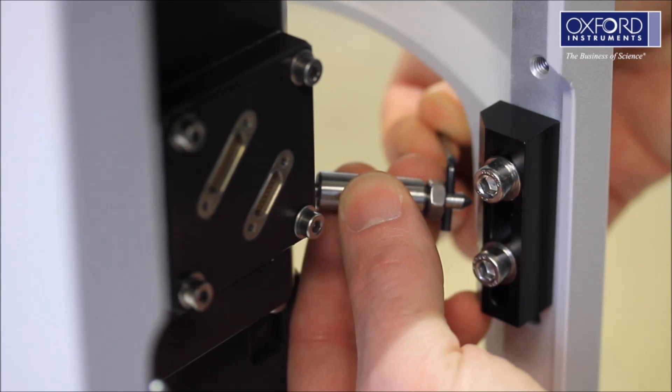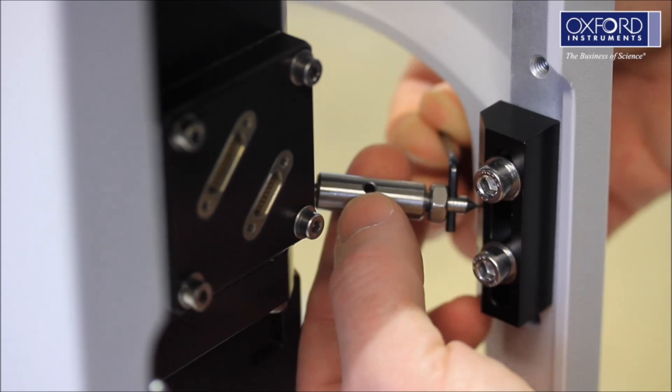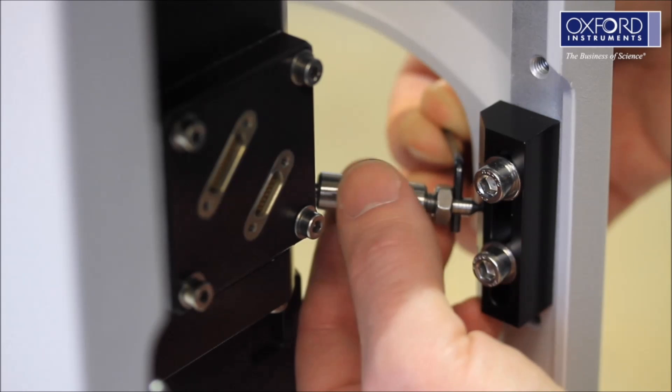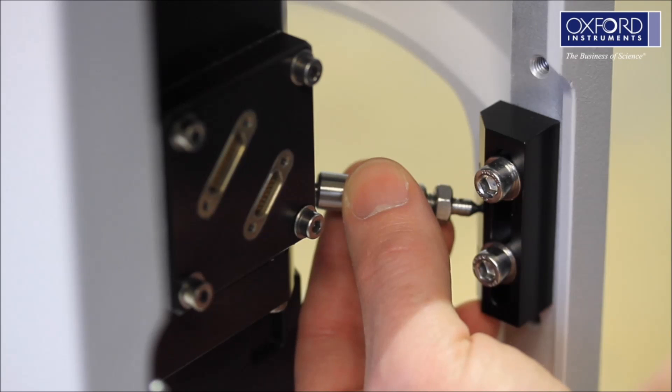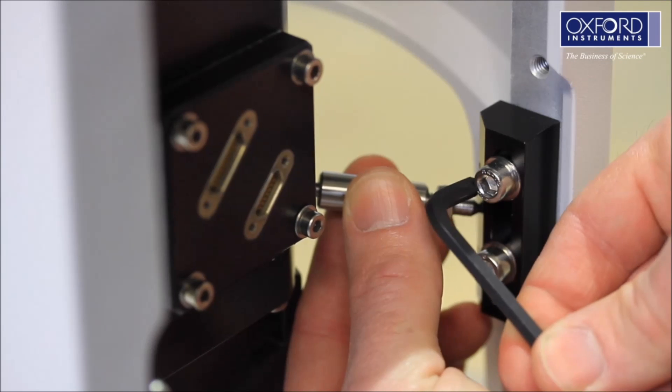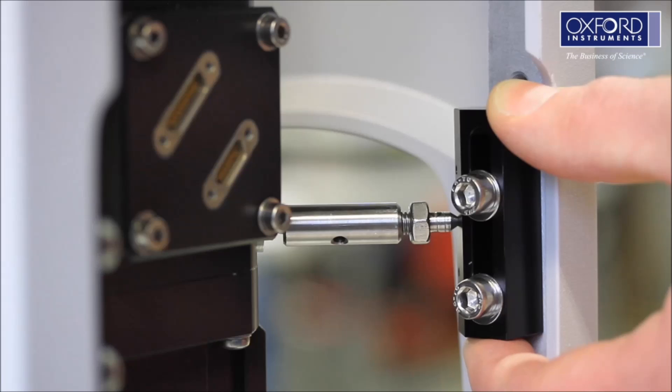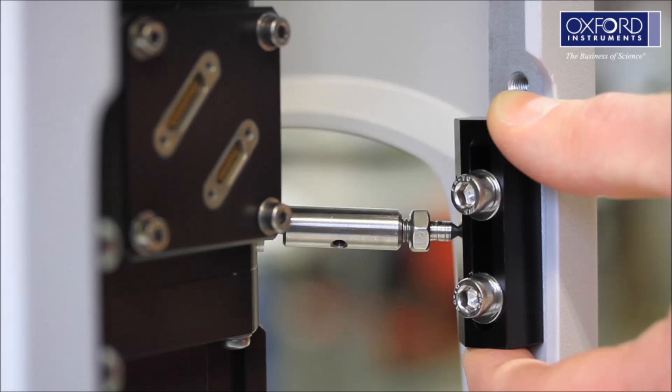Insert an Allen key in the through hole and lengthen the radial restraints using your fingers. You may need to adjust the height of the locator block to ensure the radial restraint is horizontal. When the block is in the correct position, tighten the screws.